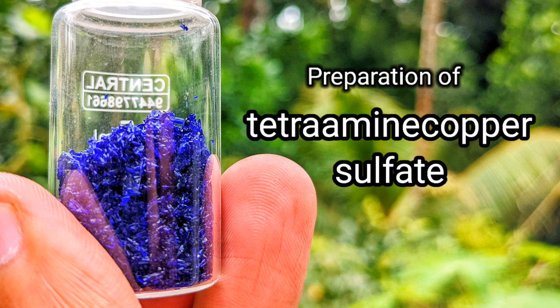Hello friends, in this video we will make the complex tetramine copper 2 sulfate.